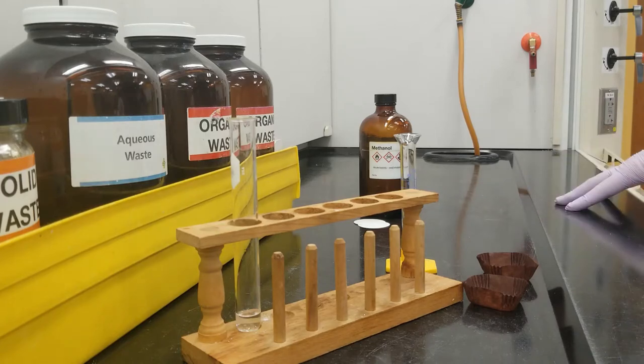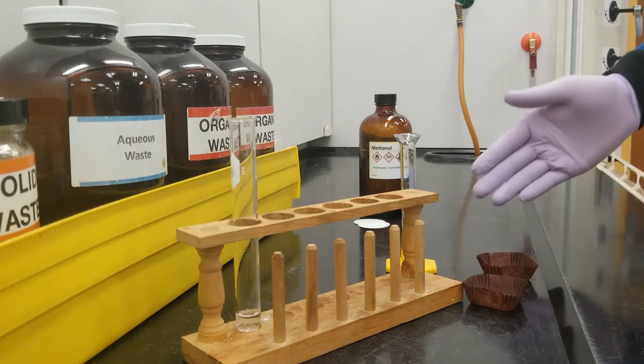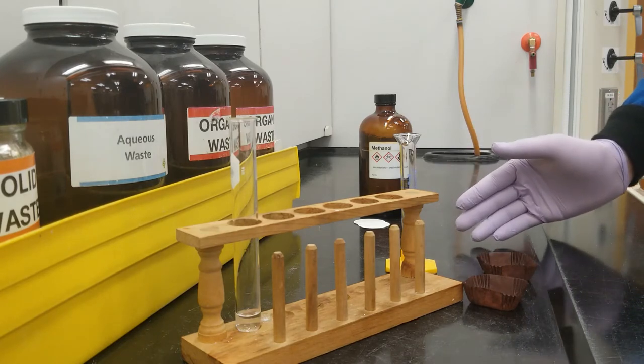Hey everyone, so we're back in the hood today to show you guys how to do the reduction of benzophenone.